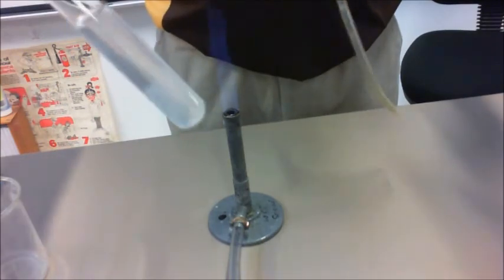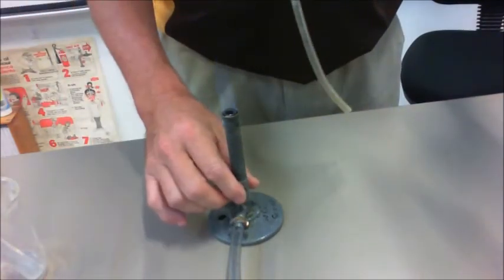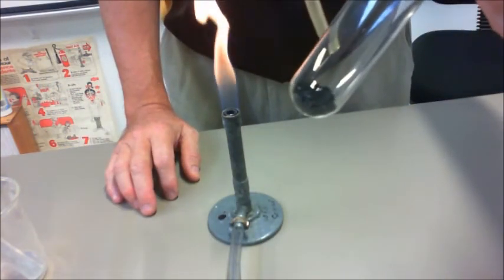So, as you can see there, this represents that we have a gas present. You'll have to, from your formula, work out what the gas is, and we also have our black powder there.